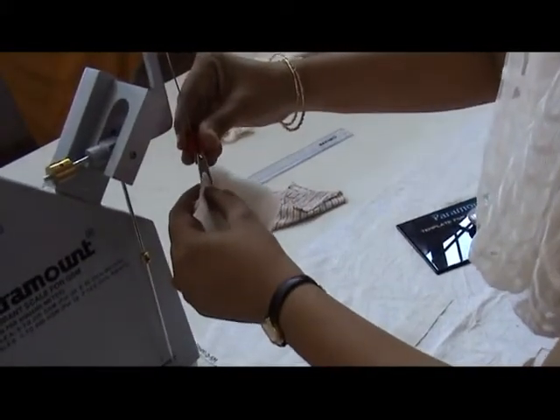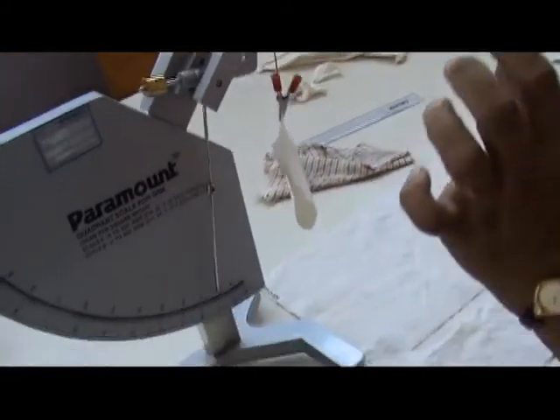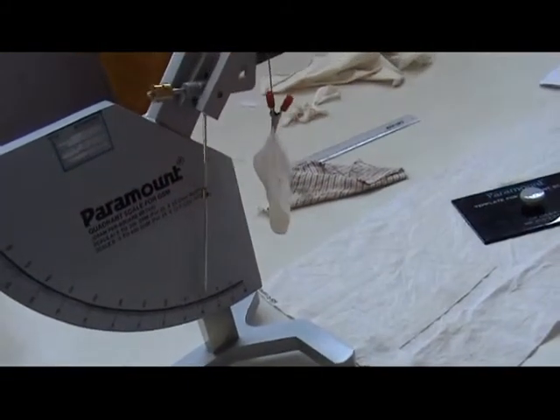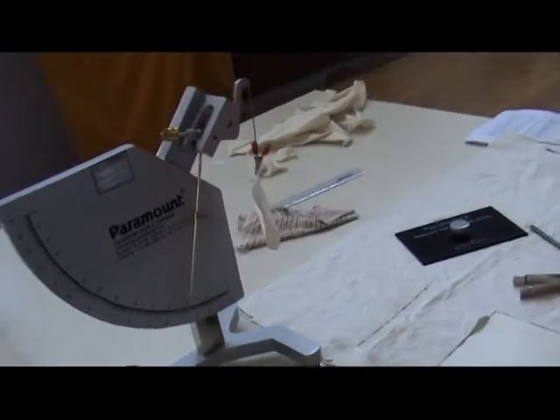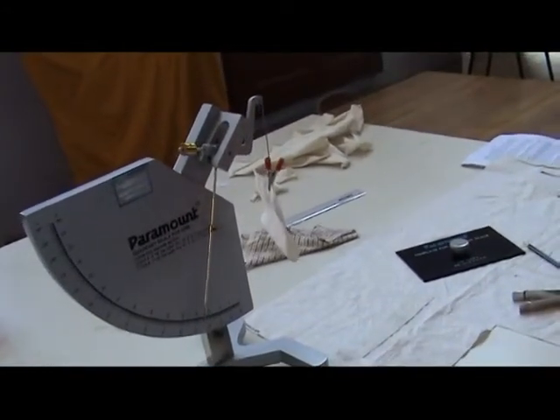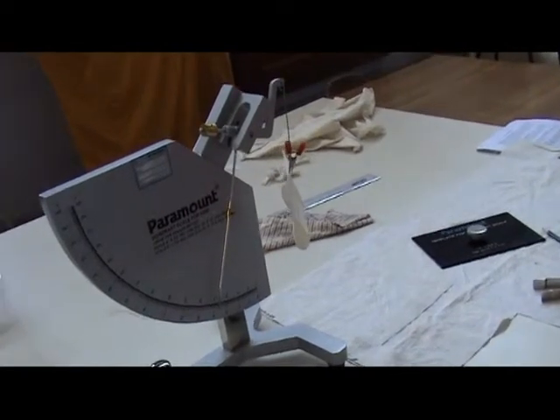One by one, the samples are hung in the clamp of the quadrant scale and the GSM is read directly from the quadrant scale.